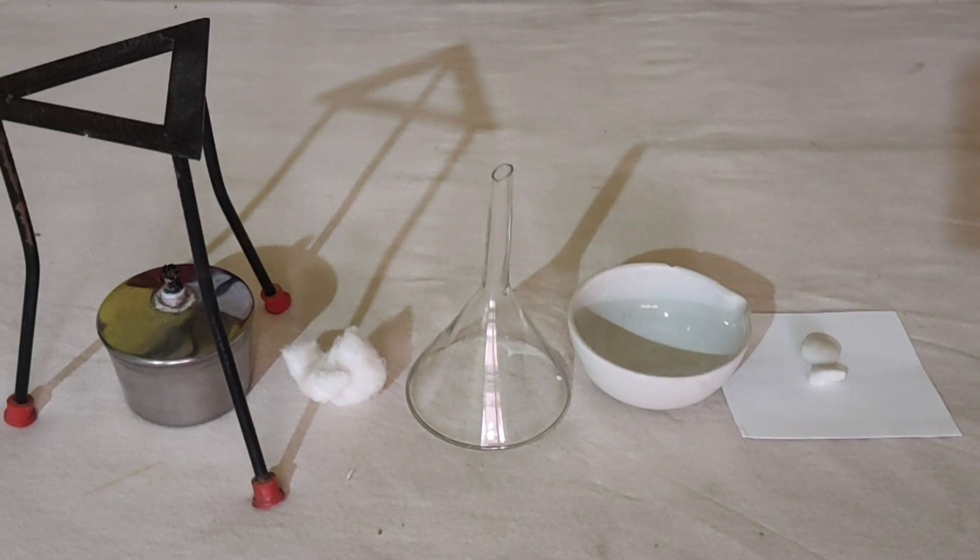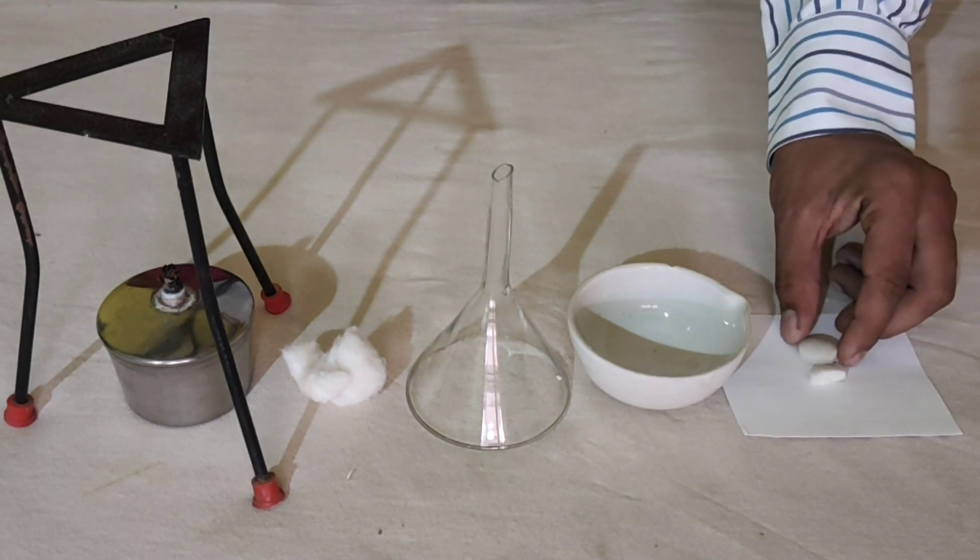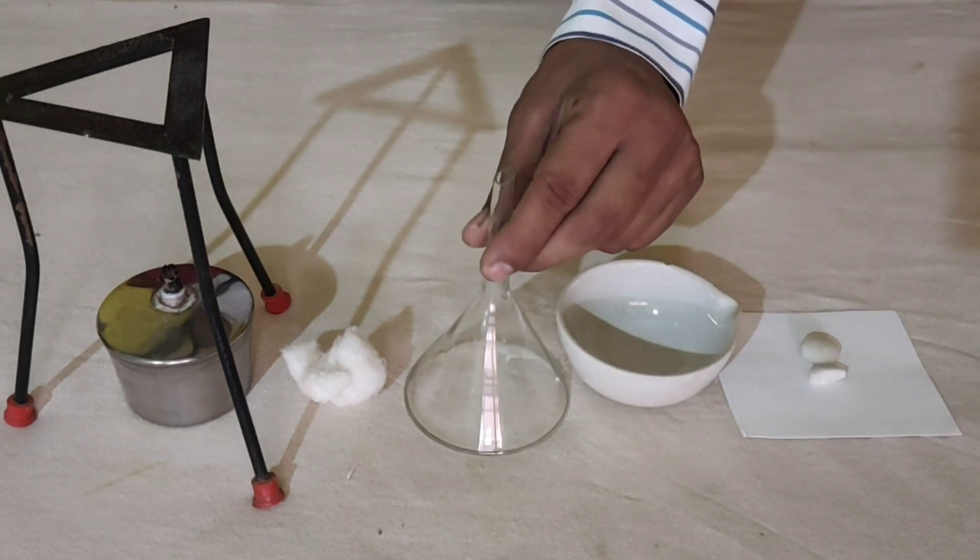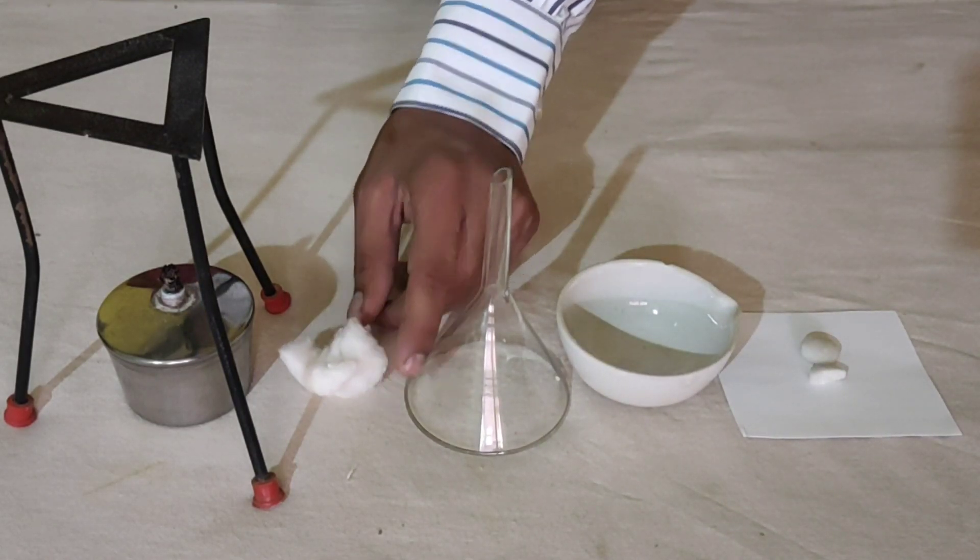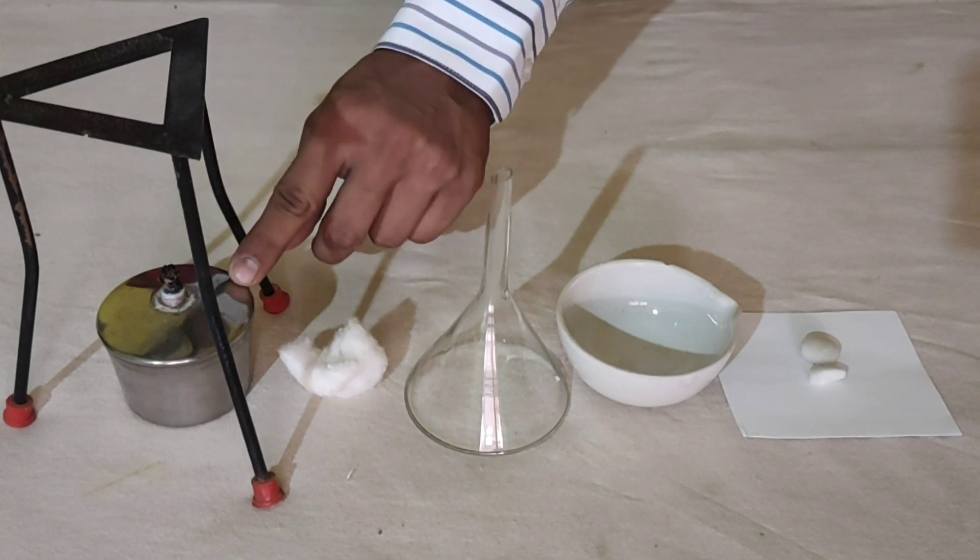Materials required for this activity: camphor, china dish, funnel, cotton, tripod stand and spirit lamp.